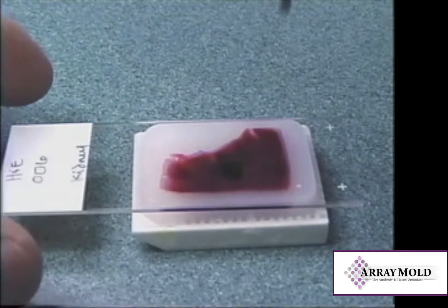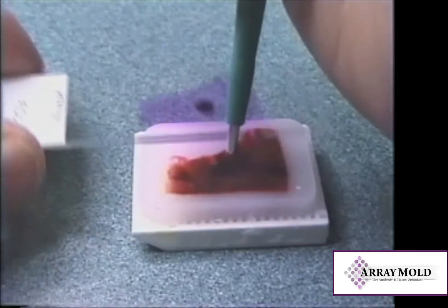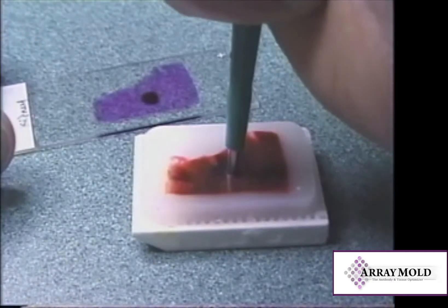Push the 2mm dermal needle into the donor tissue block. A single disposable needle can be used for an entire array protocol.